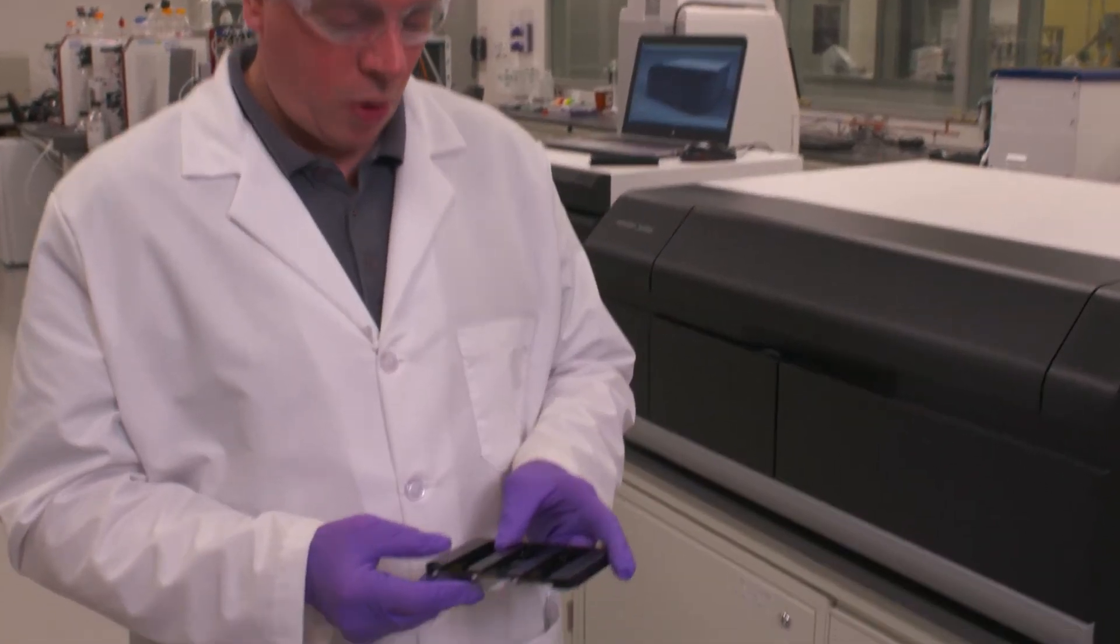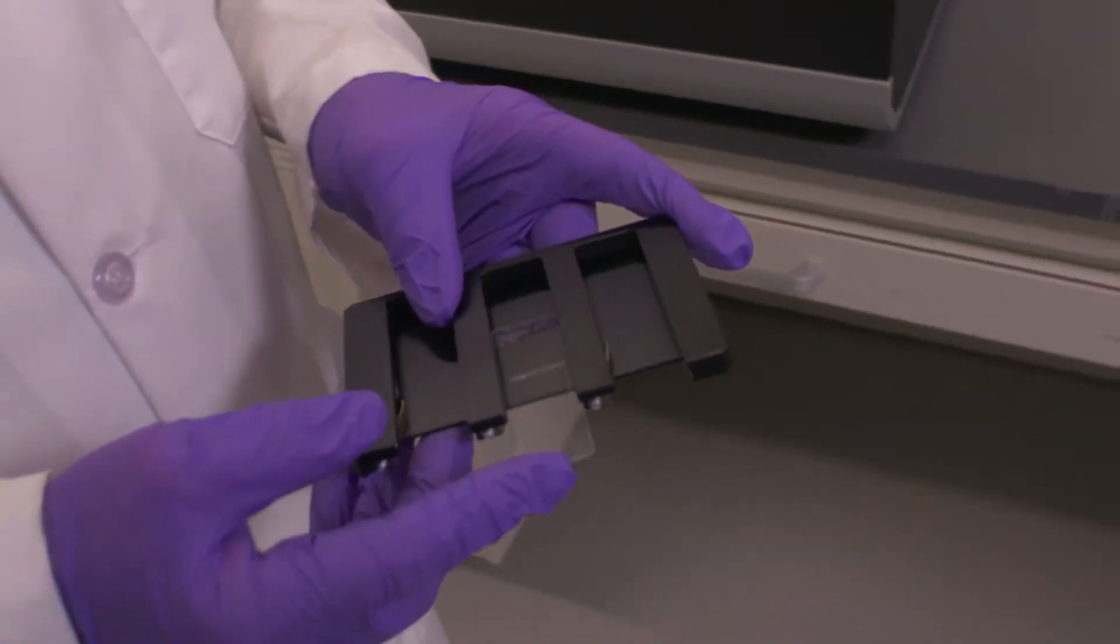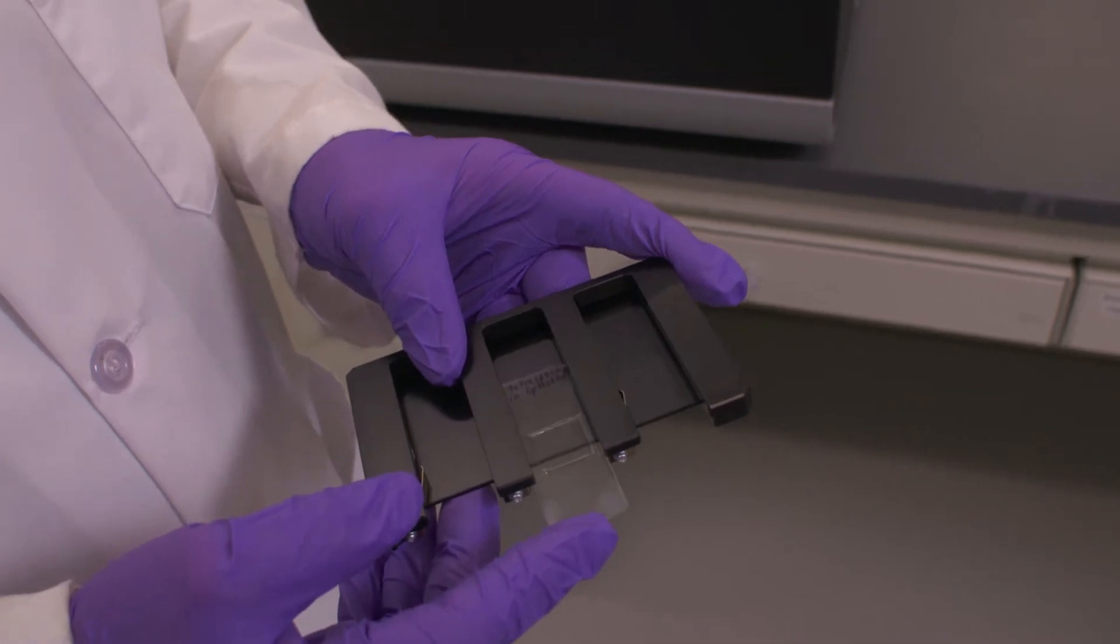In this session with the Amersham Typhoon, we're going to look at how we can use a glass microscope slide with a fluorescent tag for imaging with the Amersham Typhoon.